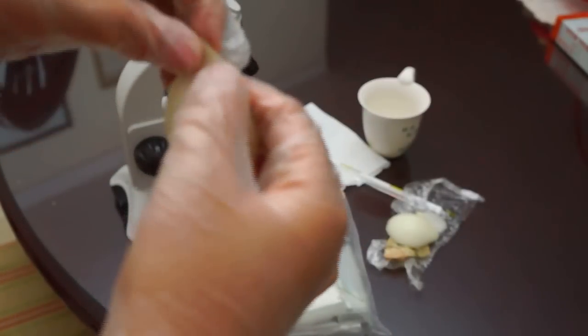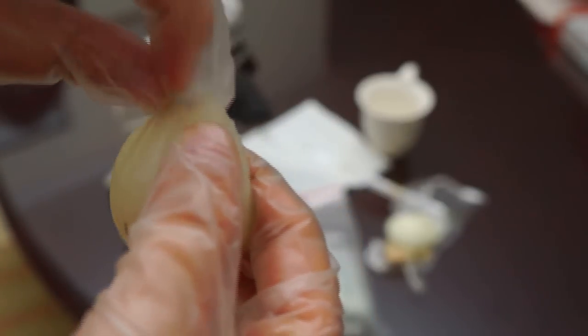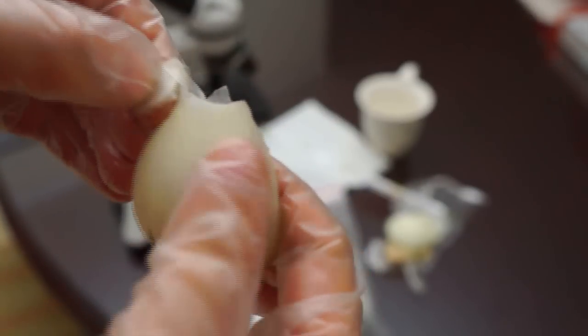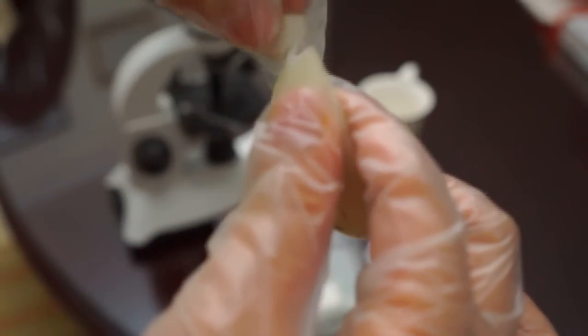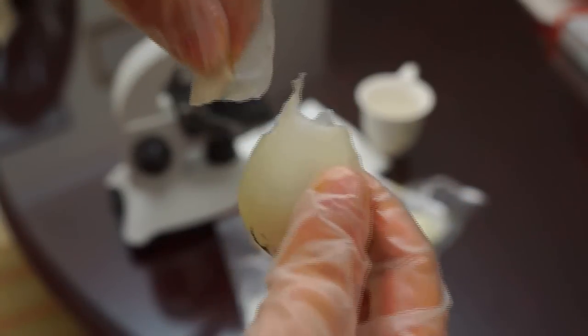We are going to crack it in the middle and you are going to see that there is like a transparent epidermis coming out like this. That is what we need.